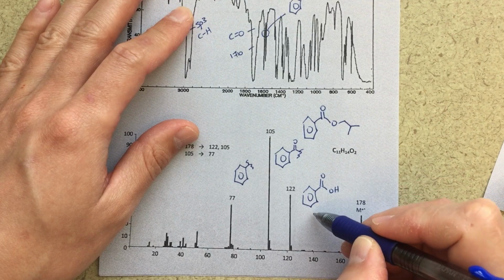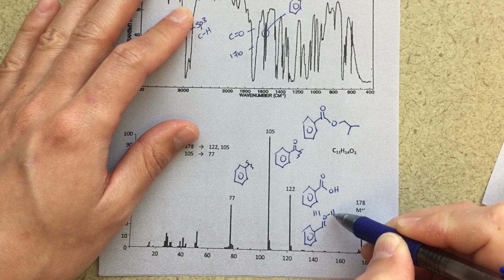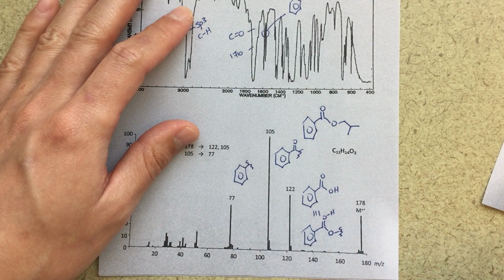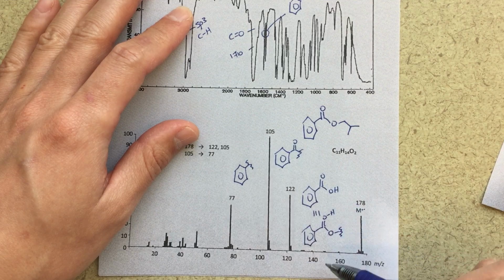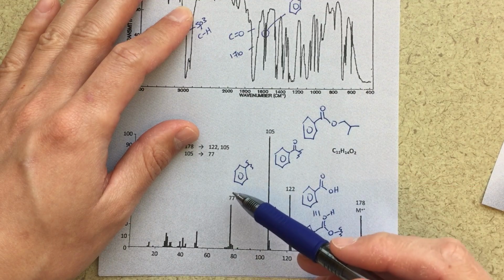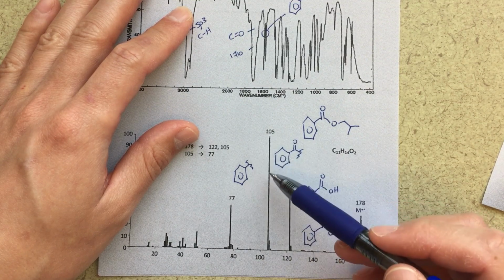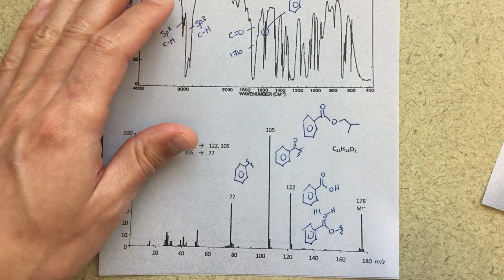So probably a better way to draw this would be that this oxygen gets protonated from over here, and then we've got the cleave. So this is my fragment that's at 122, and this is my whole mass fragment that we see here. So all of our fragments make sense, and again, this confirms, or maybe this is the way we would have come up with these fragments in the first place, right? This is how we know that we've got that conjugated C=O because of my fragments here. This 105 really suggests that's where my C=O is. So that's a good confirmation.